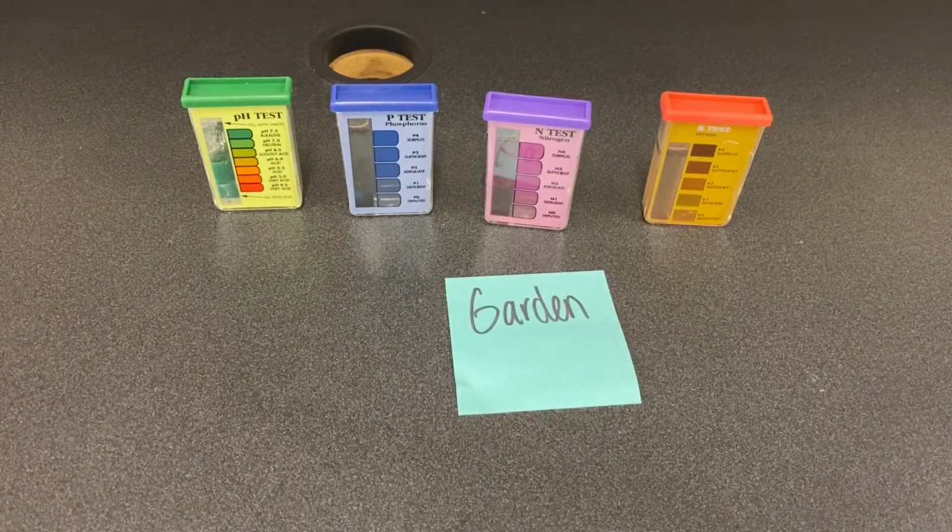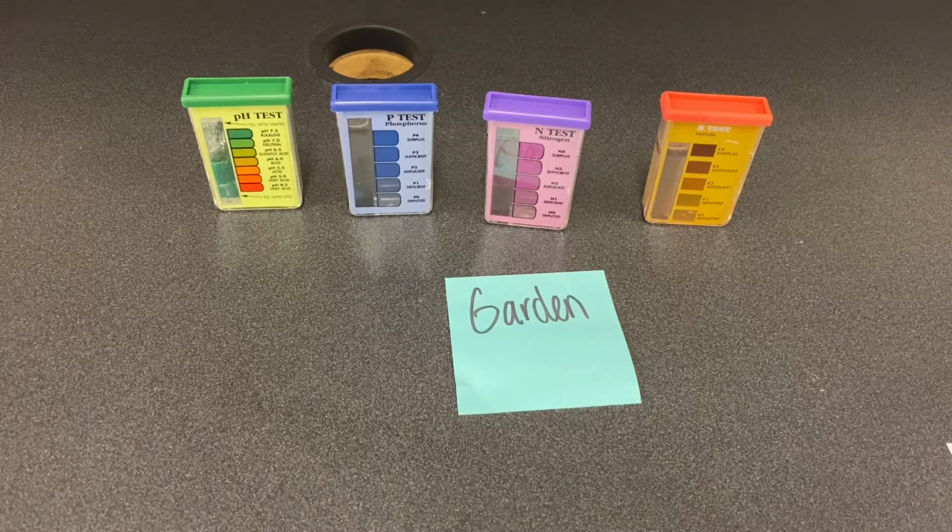Okay, these have officially sat for the time requested for the powder to react and give us a correct reading. So now we're going to take a look at the results. So what I'm going to do is show you everything and determine an actual reading. So you will see some of the answers to the worksheet as we do this together, but you will be responsible to analyze what that rating means. So remember, in the post, I am attaching the guides for how to read all these levels and what the recommendations would be. So you're gonna have to complete that part of it.